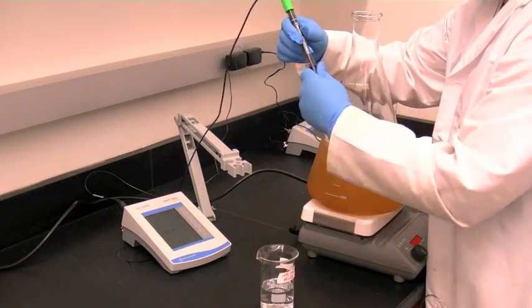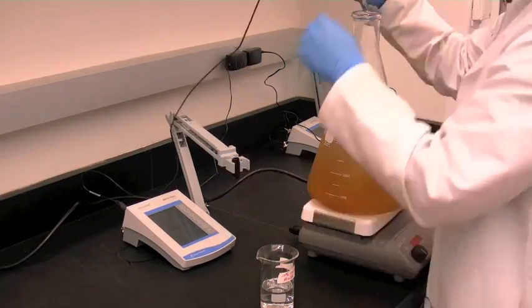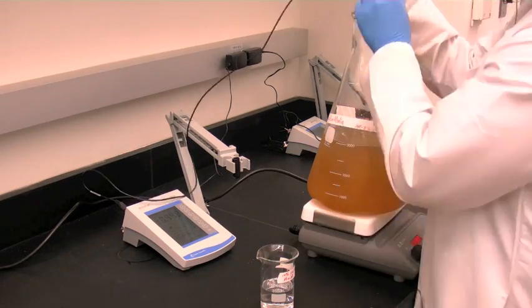Calibrate pH meter and then hang pH probe into flask so that the bulb on the end is just under the solution surface.